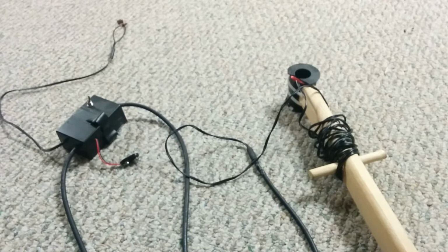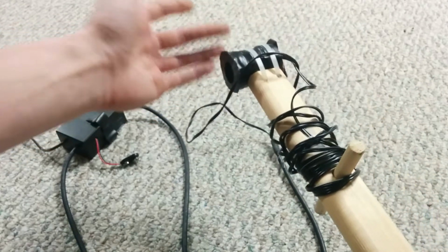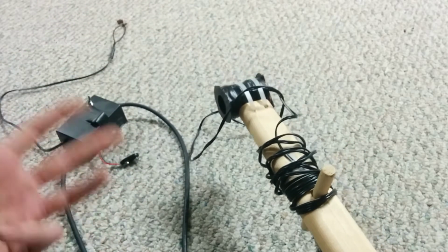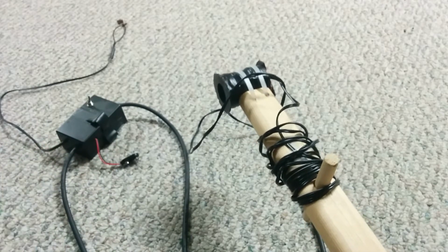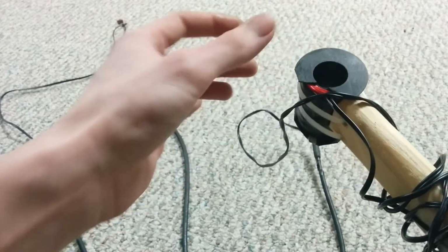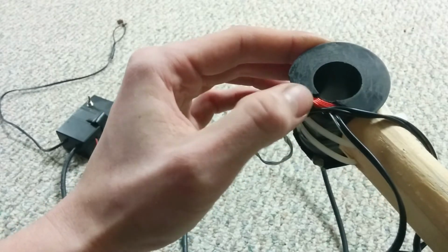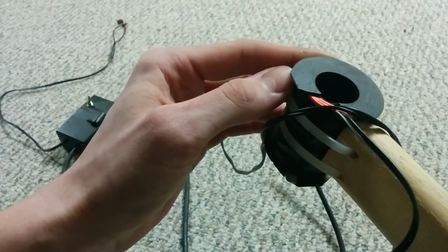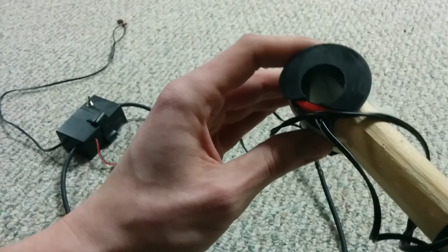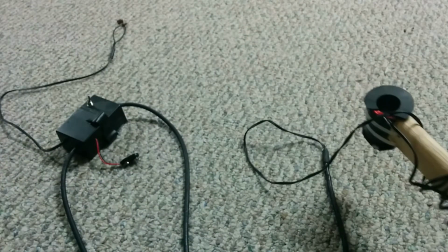I've got obviously the coil here, and this is just an off-the-shelf bobbin of copper wire stock. I had used half of it for other stuff, and I decided I'll just commit the rest of it to this project. And it took a fall, I think, before it was in this roll. So you can actually see the windings exposed there to get a sense of the density, the size of the wire, and so on. I don't know exactly what it was. It didn't have a label. I got it at a surplus store or something like that, unlabeled, junk, but good solid wire.